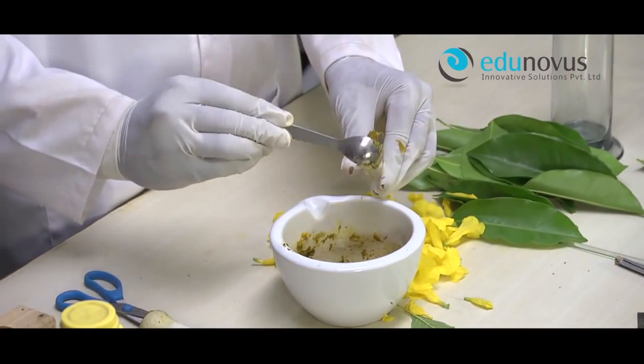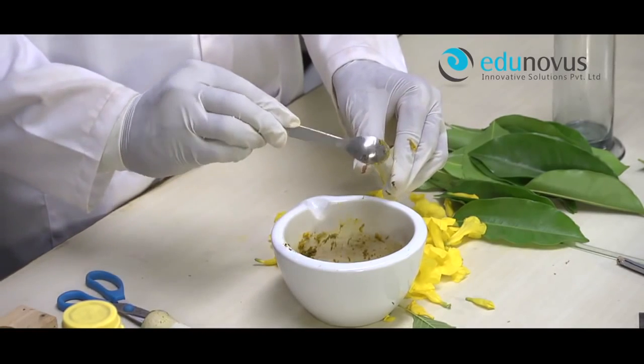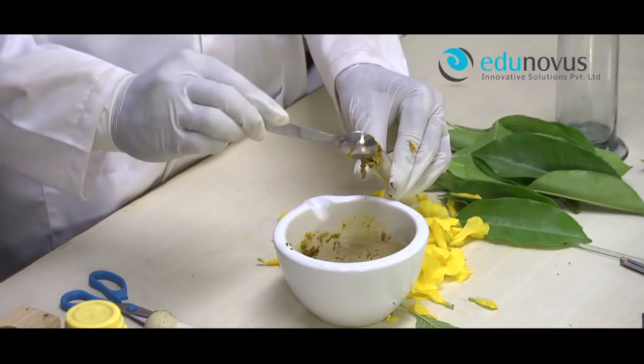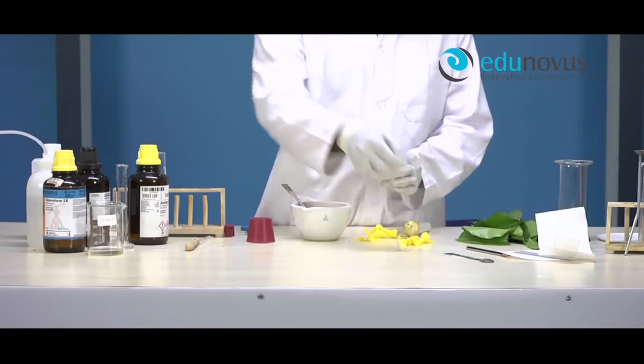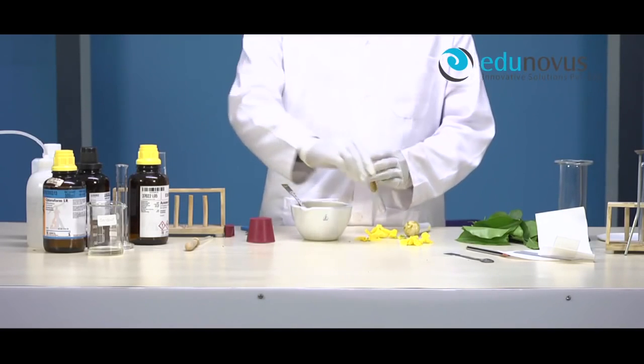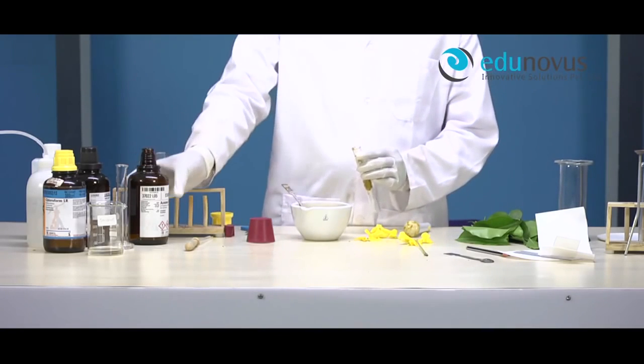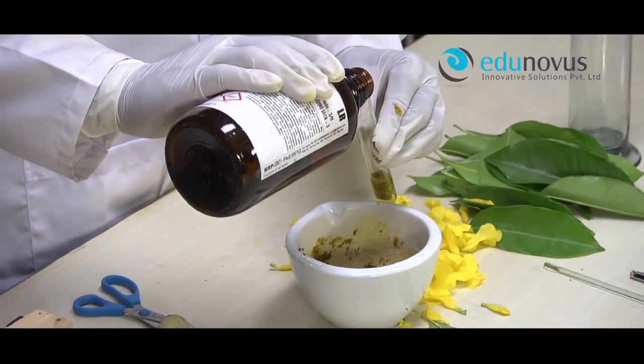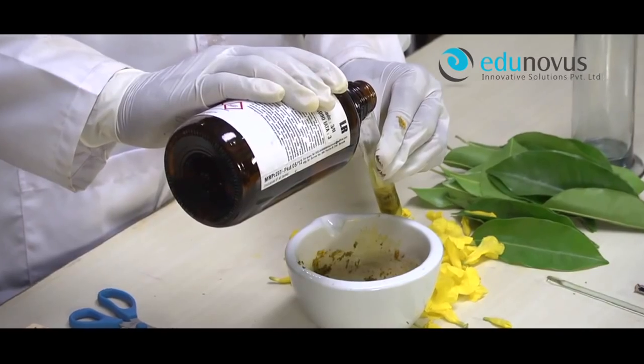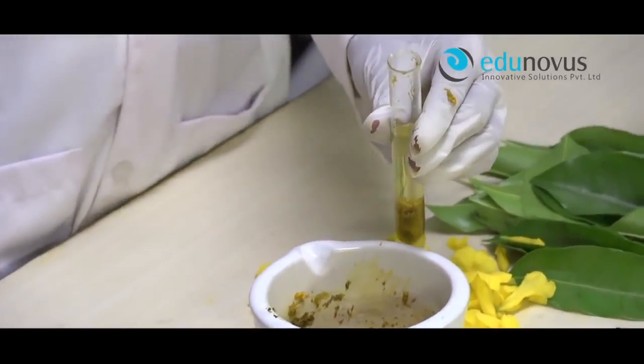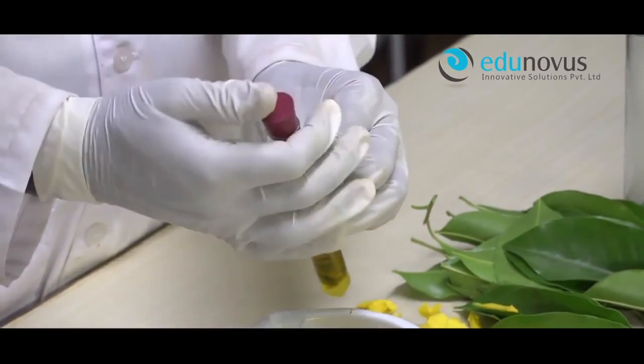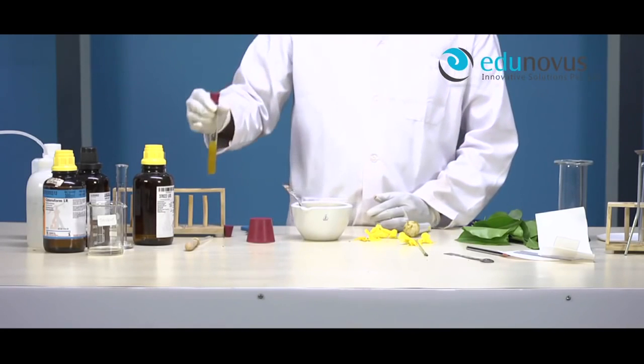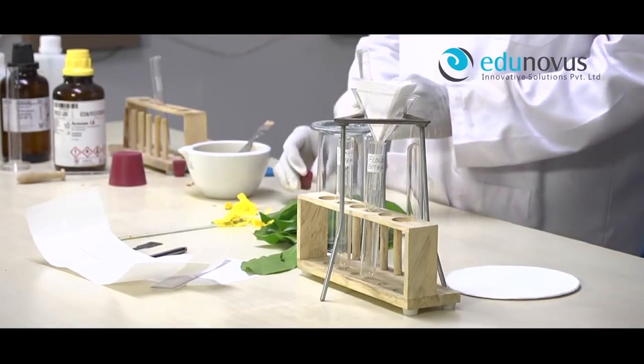Take the flower extract paste into a test tube, add a few ml of acetone, and shake it well.